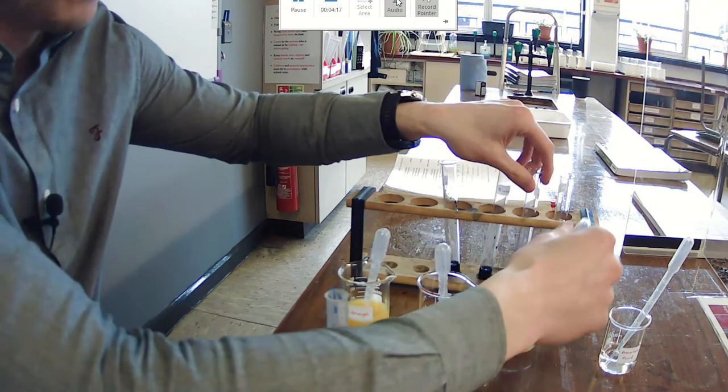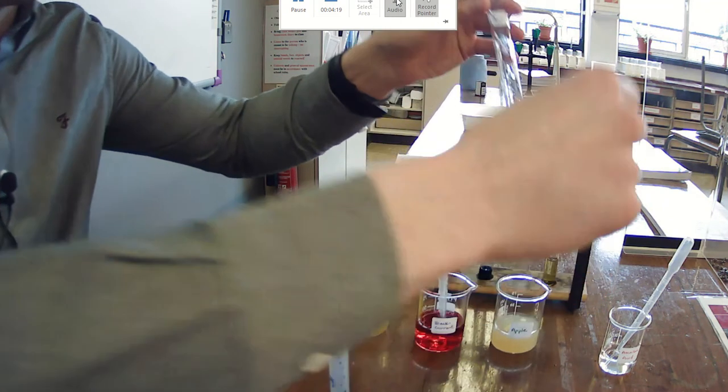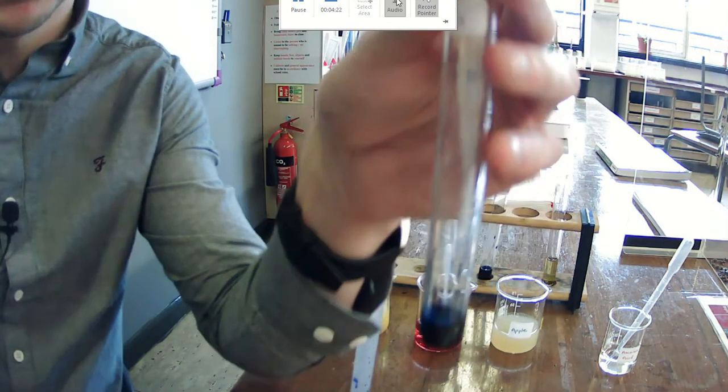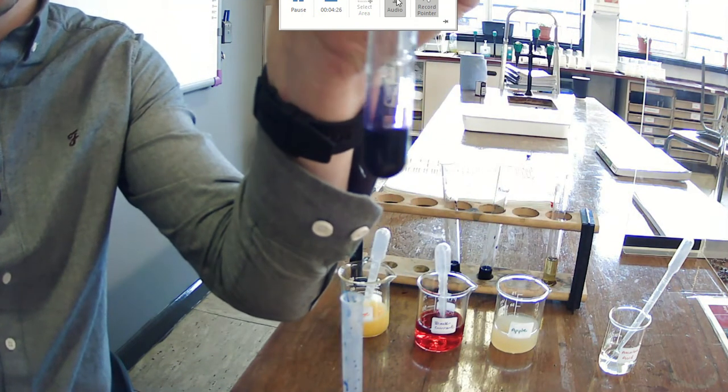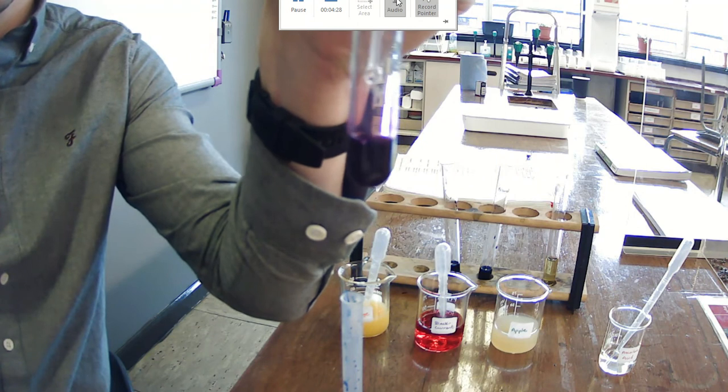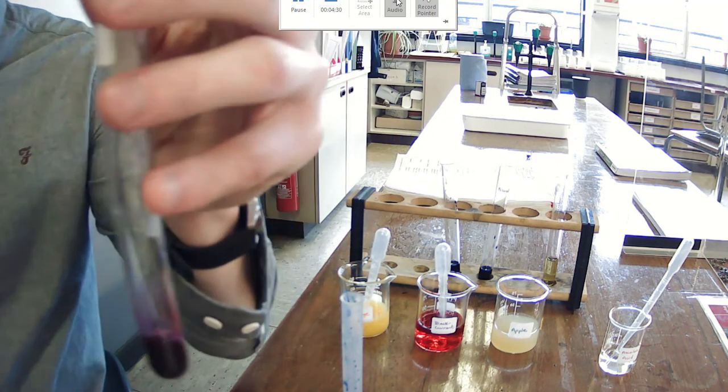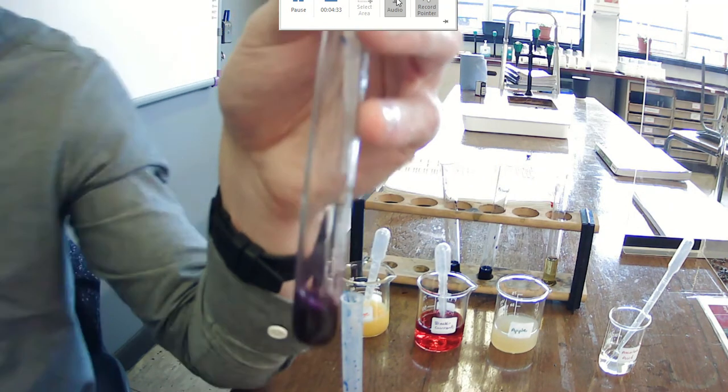So I'm now just going to pick up our apple juice. I'm going to do the same thing, so I like to drop it in and I swirl it each time. So there's one, two, three, and so on. So I'm just going to pause the video and then I will come back to you with the result.